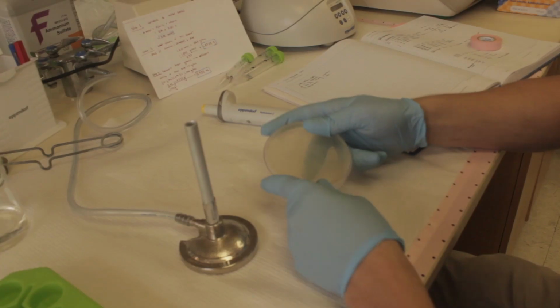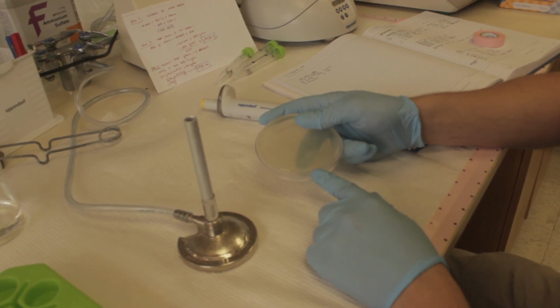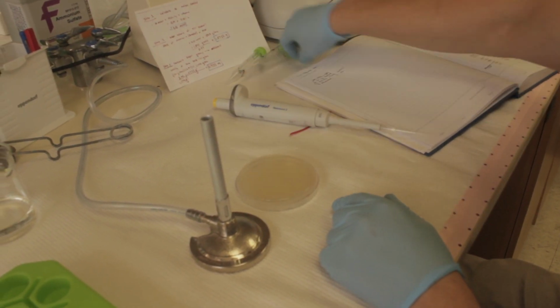But one of the most promising methods that we found works for these amyloidogenic proteins to purify them is called ammonium sulfate precipitation. So once we do this procedure and we've got all of our proteins purified, we can pass it along and carry on with many other kinds of experiments with these protein products.